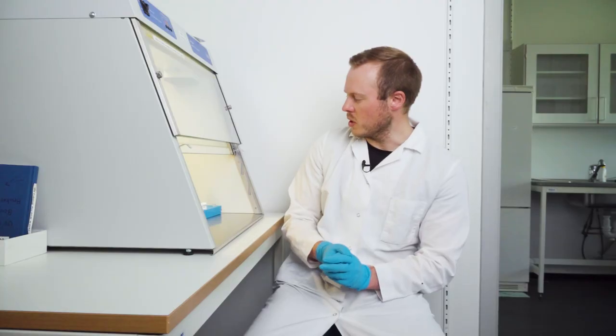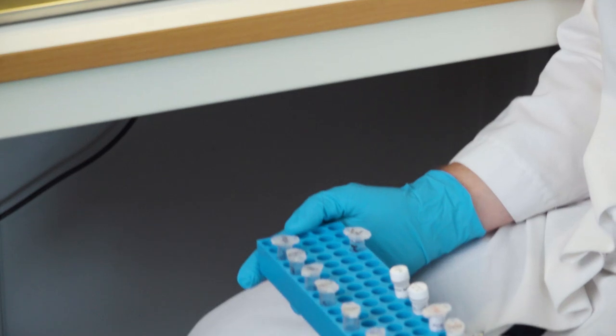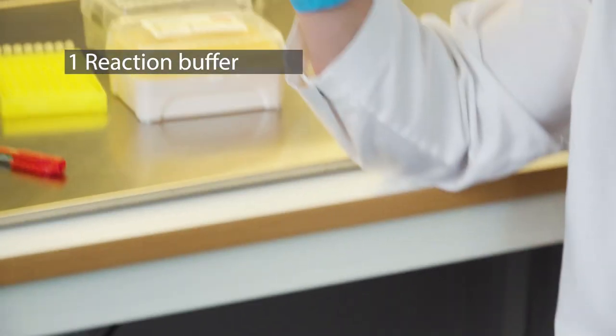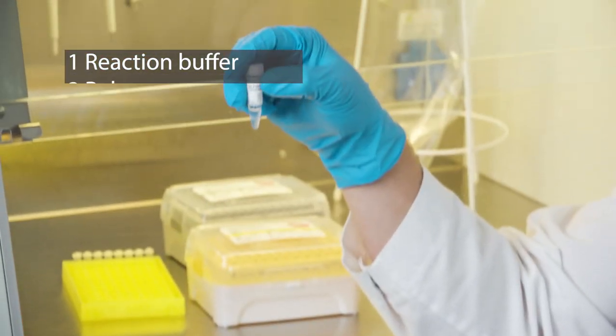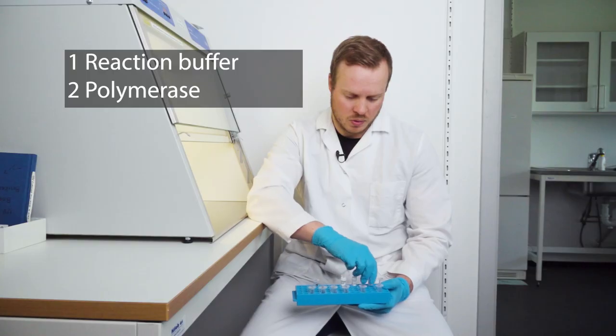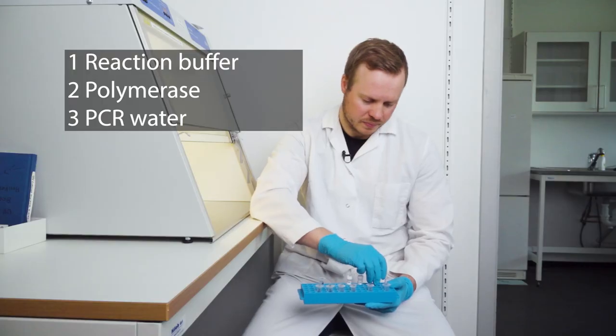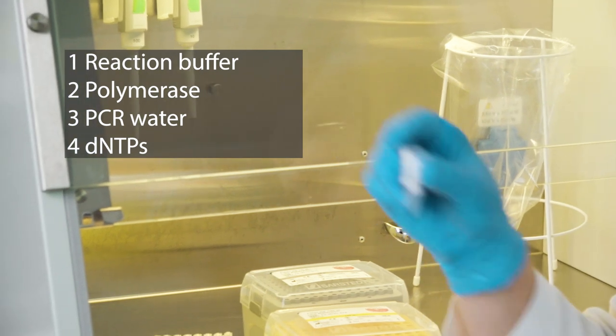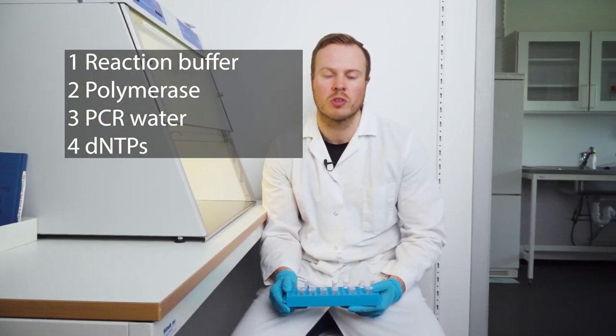And for this master mix, it's a little bit different than the other. We still have the Q5 reaction buffer. We also still add the polymerase. We also add clean PCR grade water. And we add the dNTPs. So these things are similar and in the same concentrations.